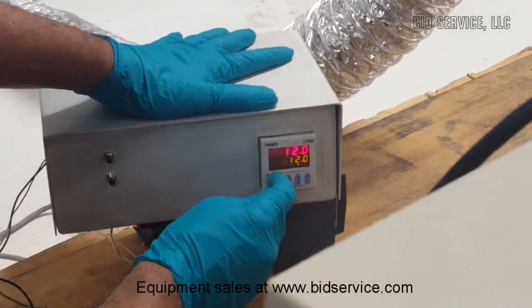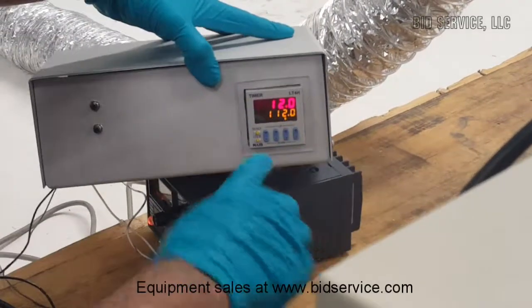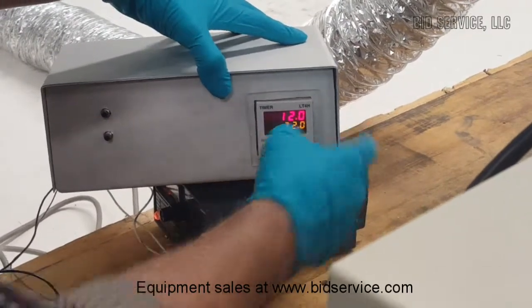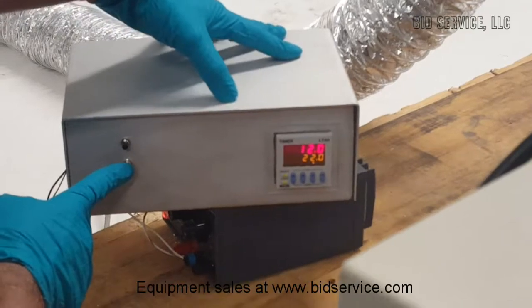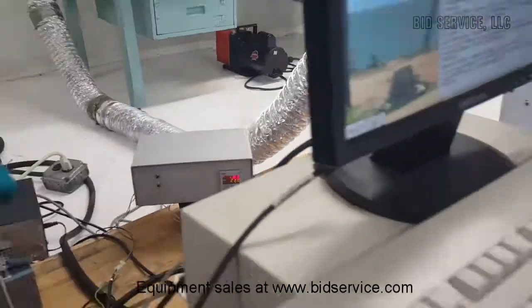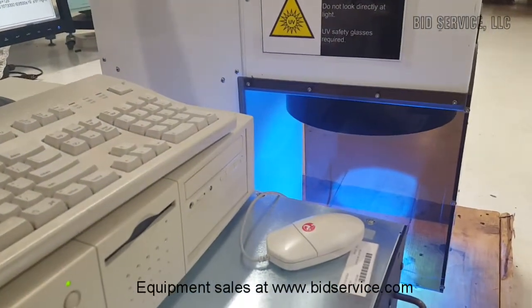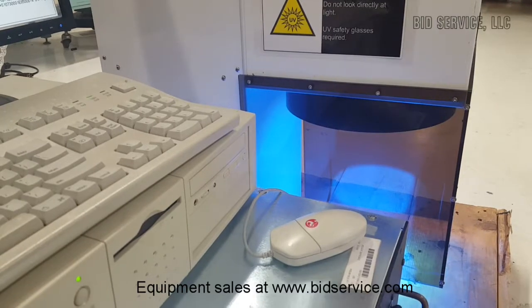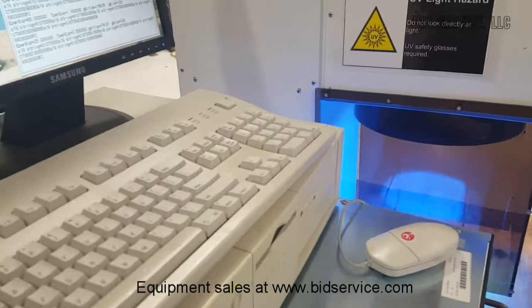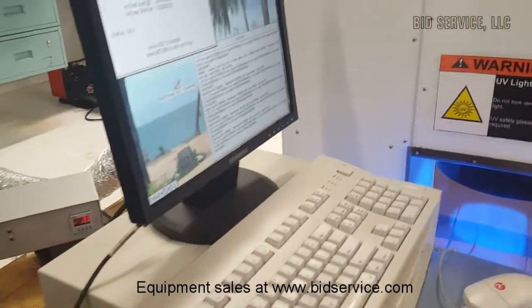You can increase or decrease the digits here. The lower digits are the set time, and the set duration can be increased. Then this will be the start button. You press start, the shutter opens. For 22 seconds I have set it. This way the shutter won't open multiple times. This digital timer will be included with the machine.